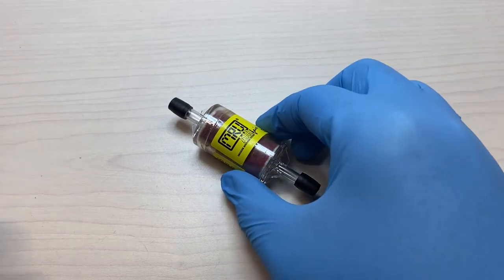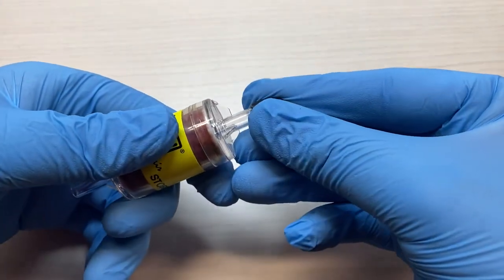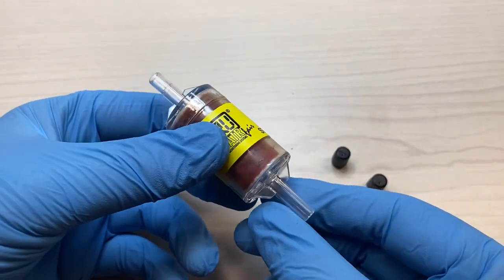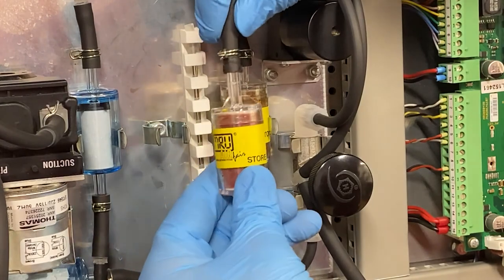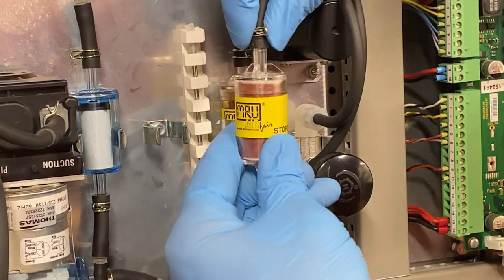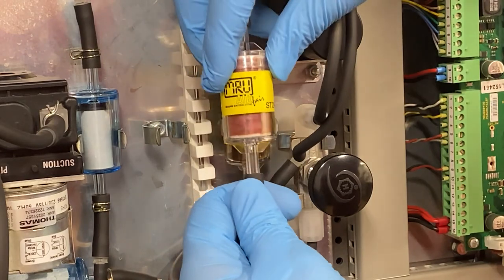Before replacing the new filter, ensure the rubber stops have been removed from both sides. At that point, reattach the tubing to the top and bottom of the filter, refasten the metal clasps, and then clip the new filter inside the device.